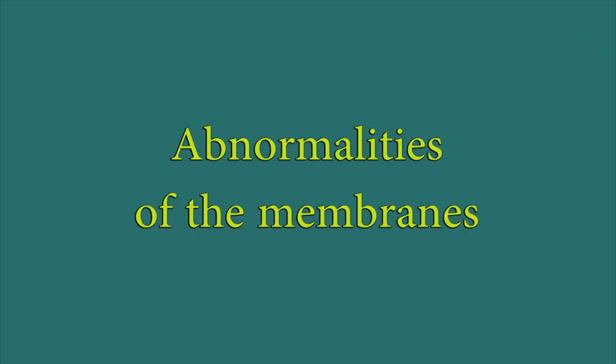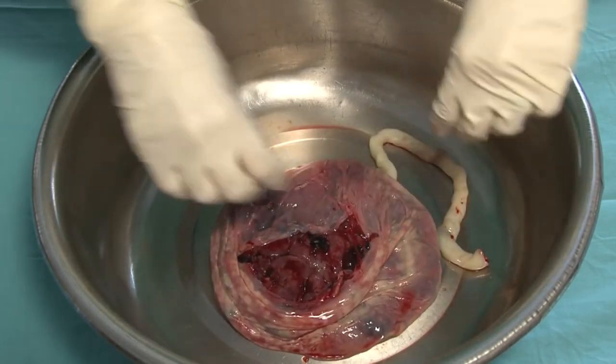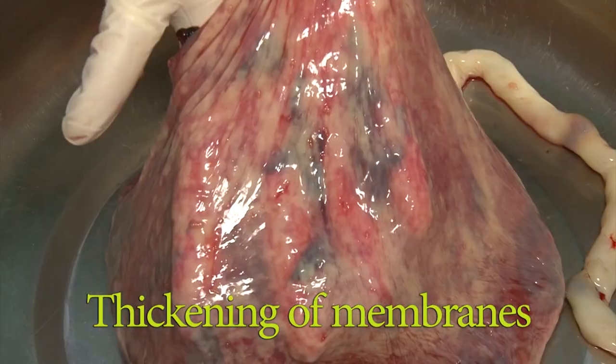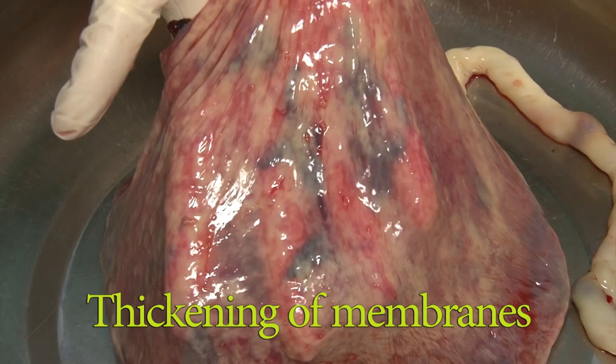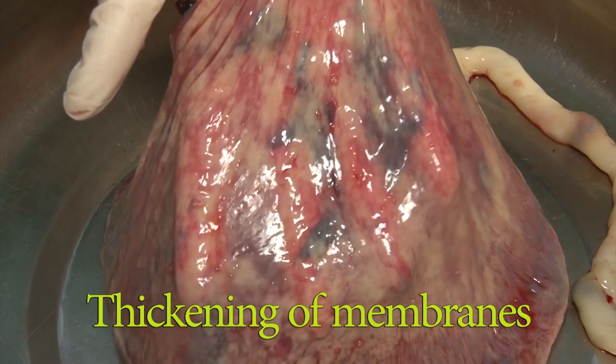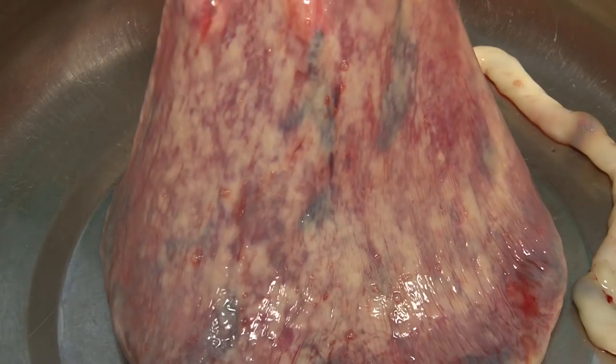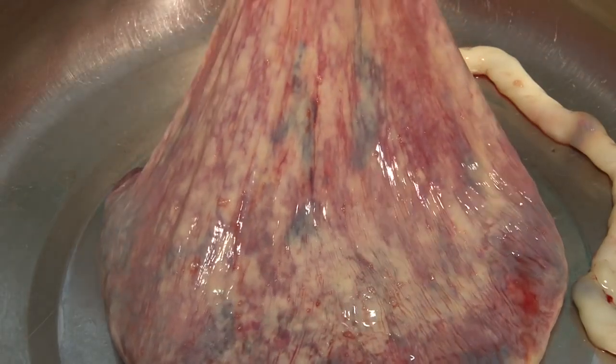In the following, abnormalities of the membranes will be demonstrated, which may become noticeable during the examination of the placenta. While normal membranes should be smooth and transparent, thickening of the membranes may represent an embryological variant of remnant decidual tissue. The condition needs to be differentiated from chorioamnionitis.